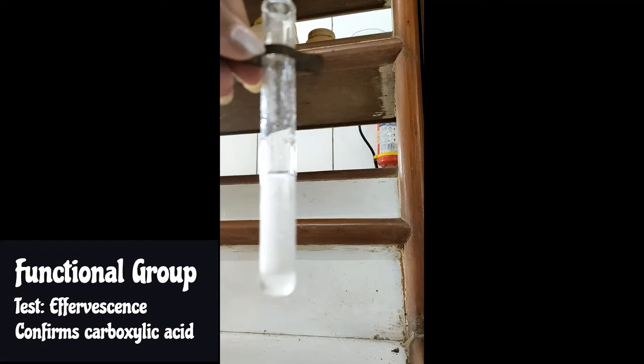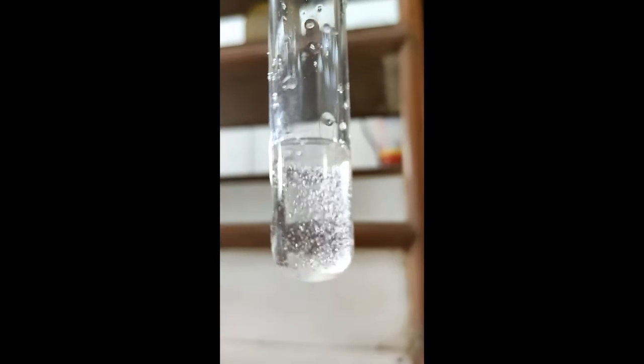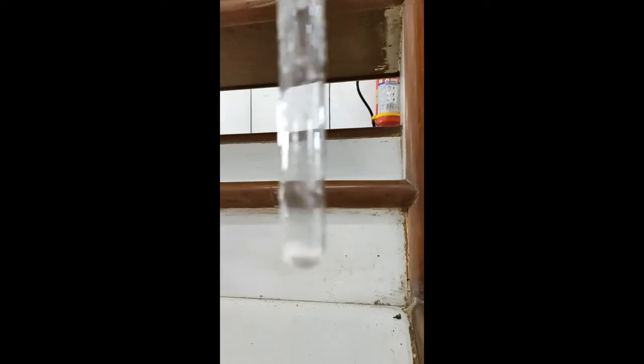Here you can observe effervescence due to the release of CO2 gas. That effervescence further confirms - CO2 is released, COOH is confirmed if it is acidic.